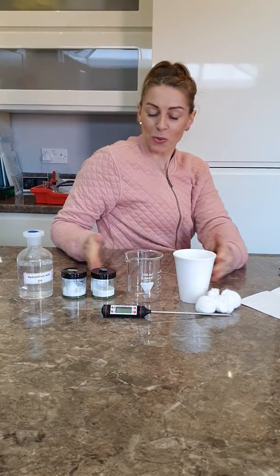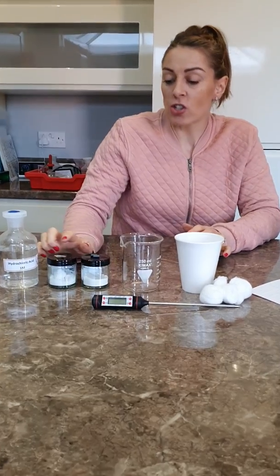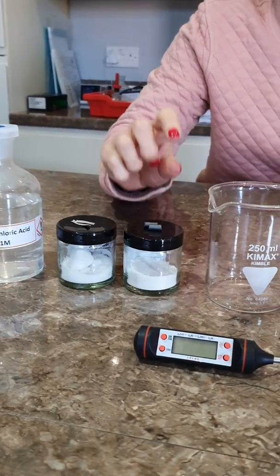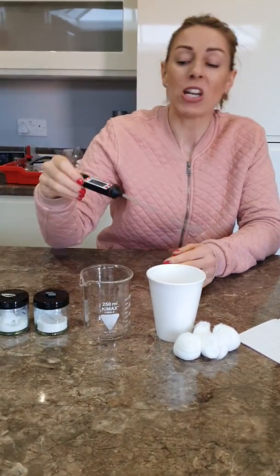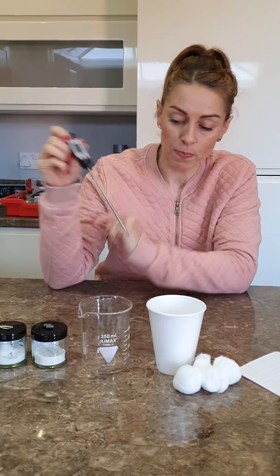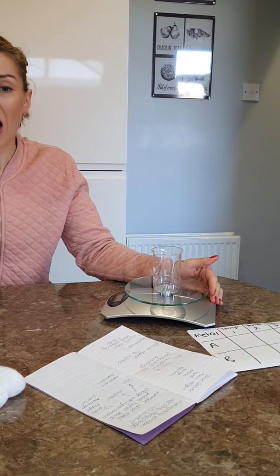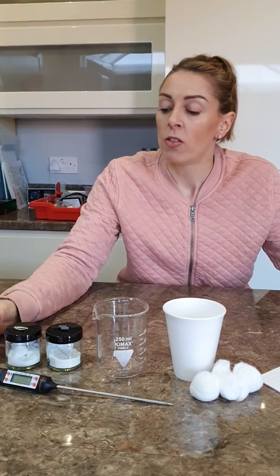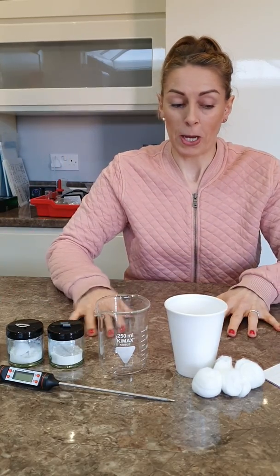Because we're going to change the type of metal, these become my independent variable — the things I'm going to change. My dependent variable, the thing I'm going to measure, is the highest temperature change. My control variables include the mass of the metal, the surface area of the metal, the volume and concentration of hydrochloric acid, and the equipment in general.